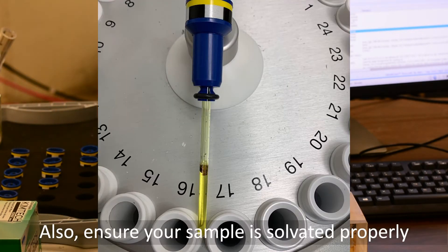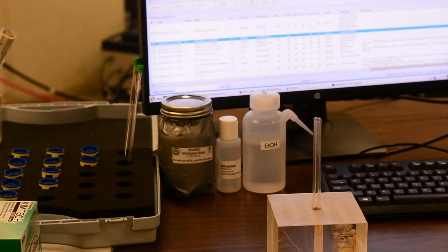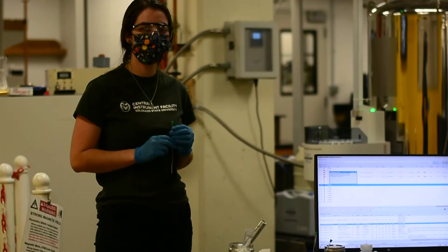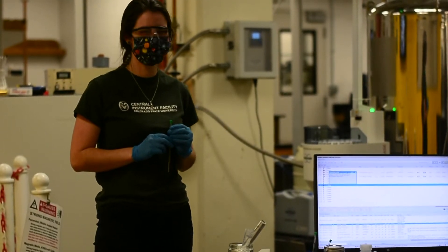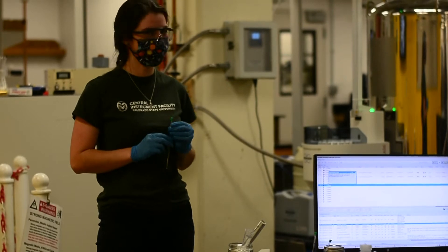The last thing to consider when preparing your samples is to not affix any permanent flags or tape or labels. Those will interfere with the tube when it goes into the NMR. Welcome to the MMA NMR training. We will start with loading your sample into the magnet.